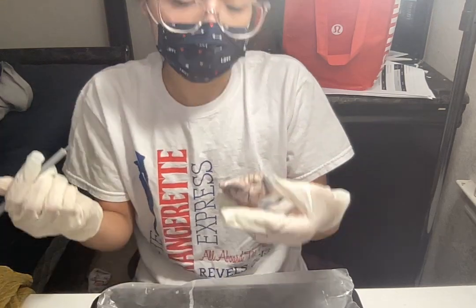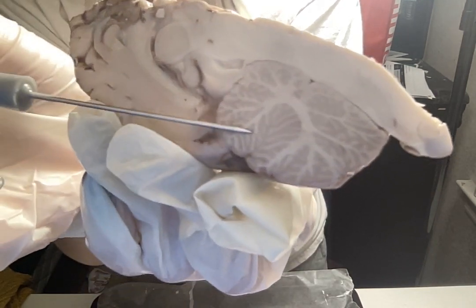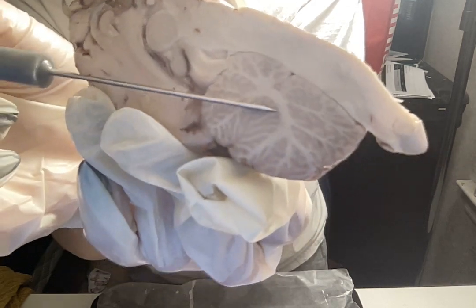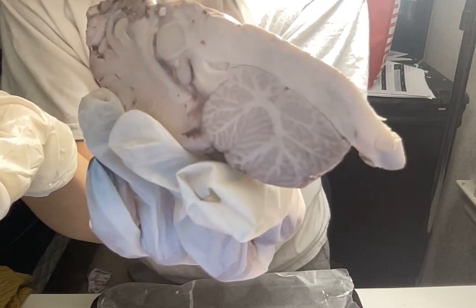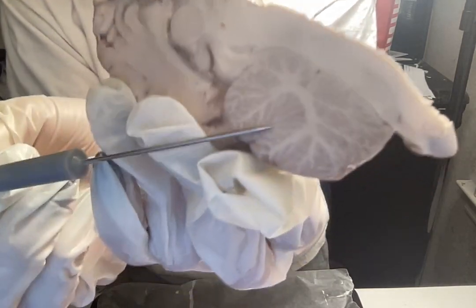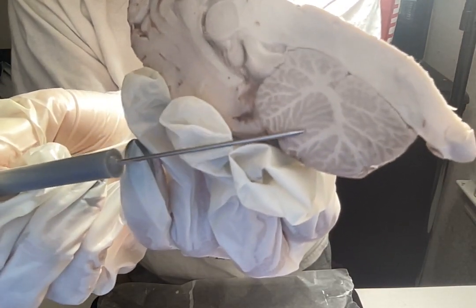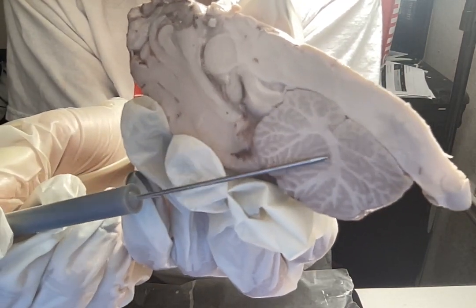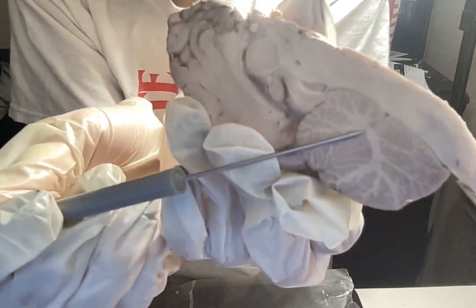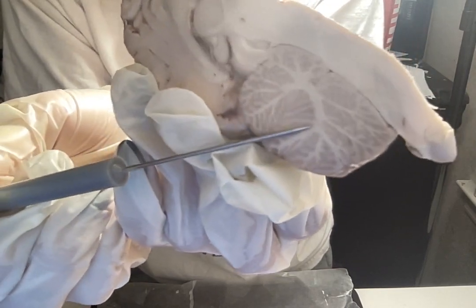So, going inside of the cerebellum here, you can see the white shade and then the gray around it. So as you can see, it's almost like roots growing out of it. They also call it tree of life because it's like, you know, roots growing under a tree. So the darker shade is called gray matter. So the gray matter consists of our cell bodies here. In the middle here, where it extends outward, is called the white matter. And the white matter is composed of our nerve fibers.